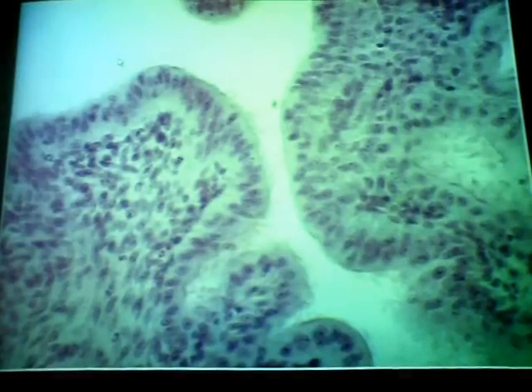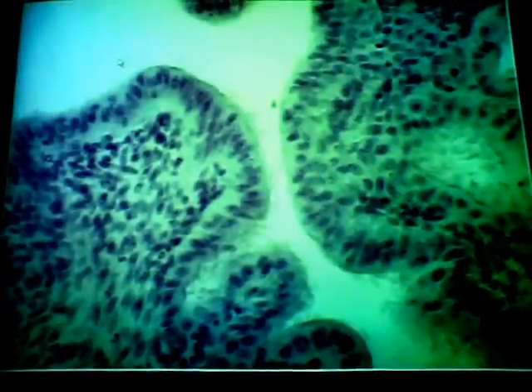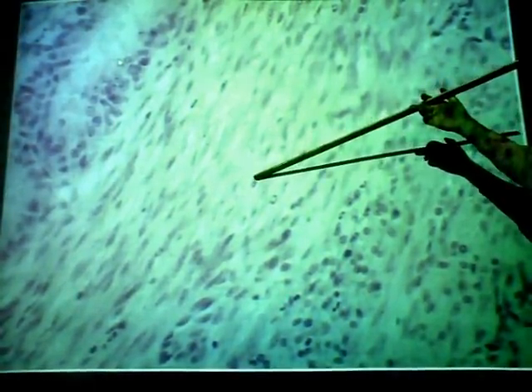Okay, and deep to that, again, this is a mucous membrane. So what do we have deep to the epithelium? Lamina propria. And then deeper, external to that, we have the muscle layers. But unfortunately, the arrangement of the smooth muscle here is not the same as it was in the epididymis and the ductus deferens of the male. It is reversed. And don't ask me why. Inner layer is circular smooth muscle. The outer layer is longitudinal, just like we saw in the GI tract.